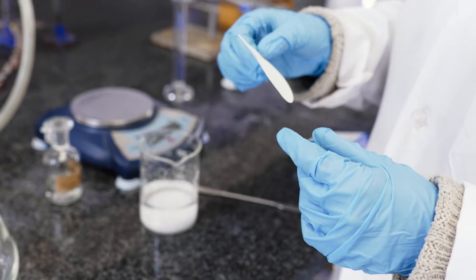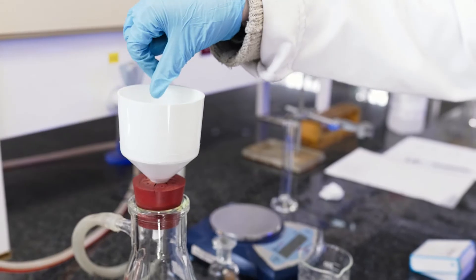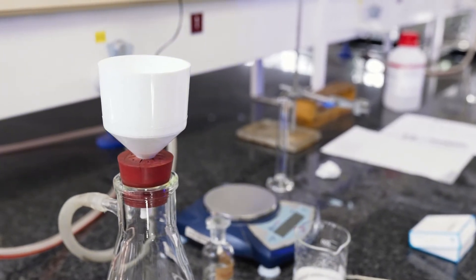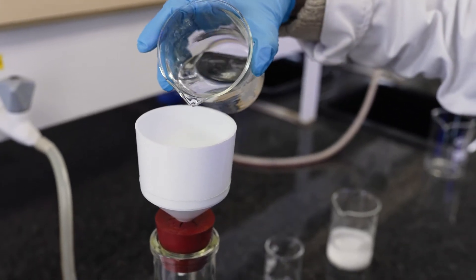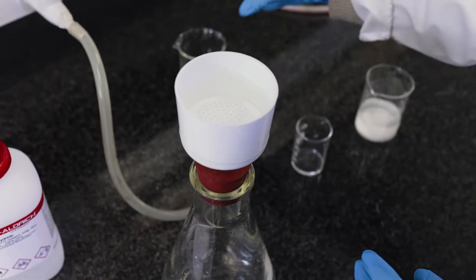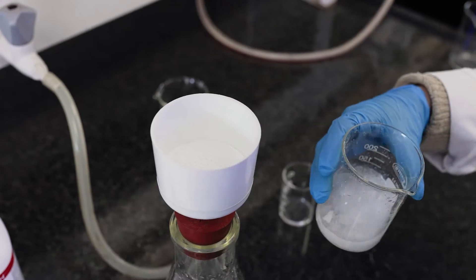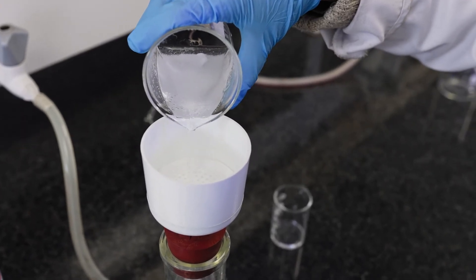Now that we've added our solution into the ice water, and once all of the ice is dissolved, we can prepare the Buchner funnel. Remember that it's a vacuum filter and we need to have a filter paper in it. Once you've turned on the Buchner funnel, we can add a few drops of water to make sure everything suctions properly, and then with the vacuum on we can add our solution.